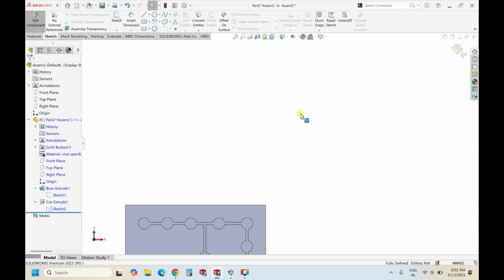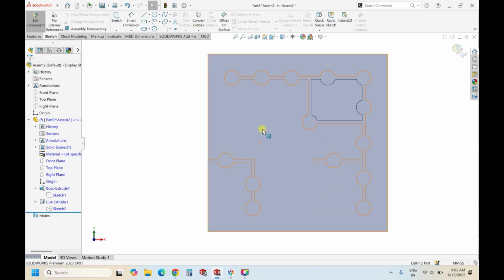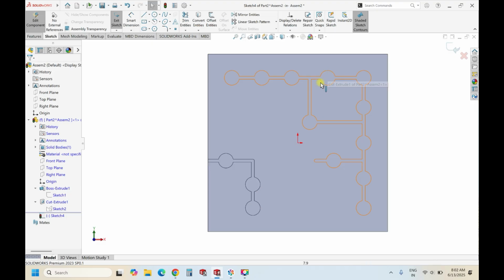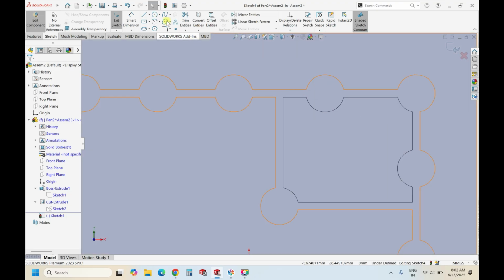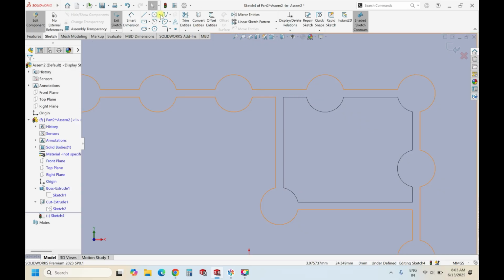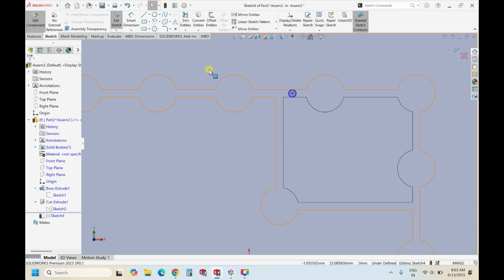To do that, just select this sketch. Basically again select this sketch, this face, and once we have selected, randomly let's take it here. For example, I'm just planning to take it here. So better, instead of this, let's take the perimeter circle. So you can have this as one perimeter and this as another perimeter.